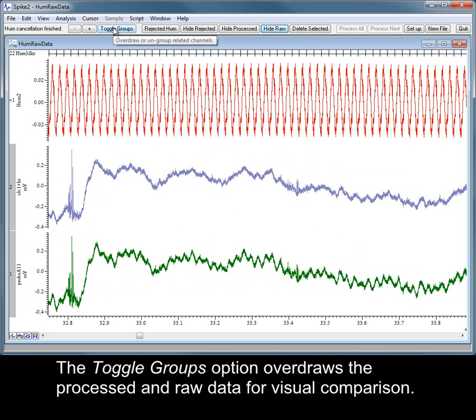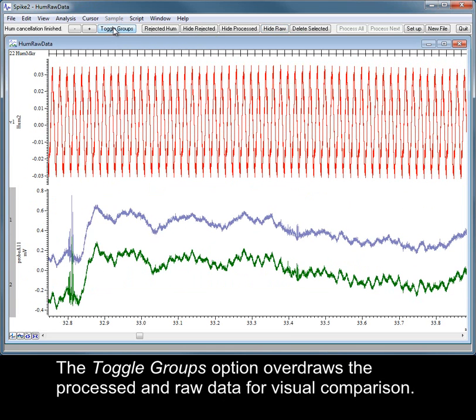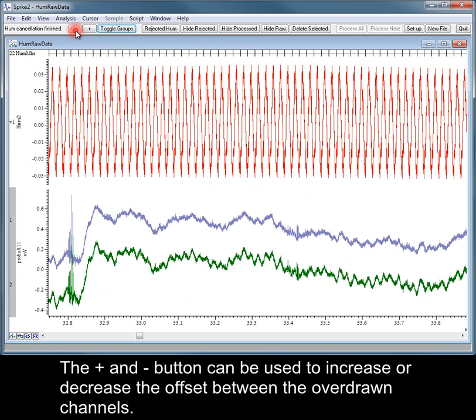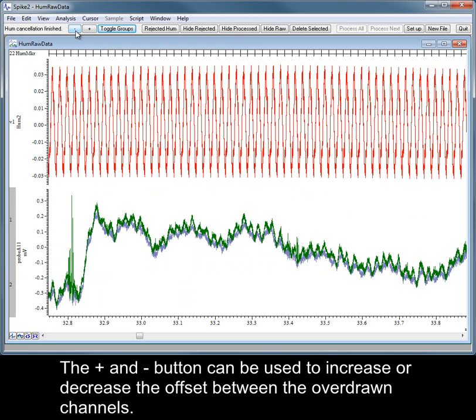The Toggle Groups option overdraws the processed and raw data for visual comparison. The plus and minus buttons can be used to increase or decrease the offset between the overdrawn channels.